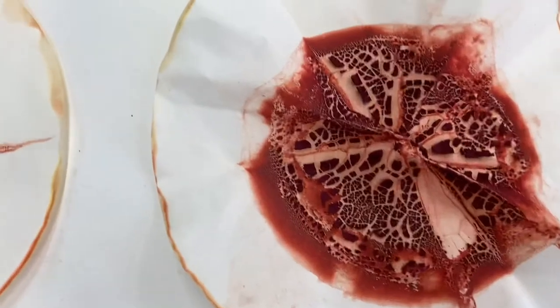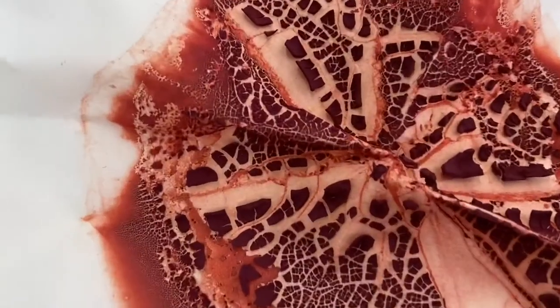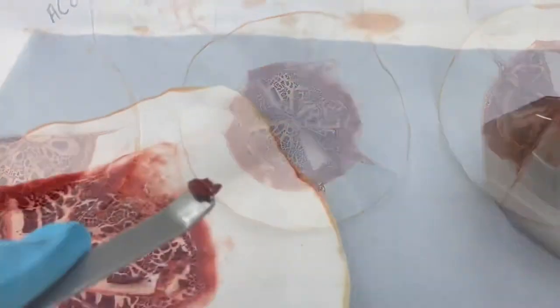Afterwards the filtration papers with the caught pigment are laid out to dry and after a few days it'll look like this.